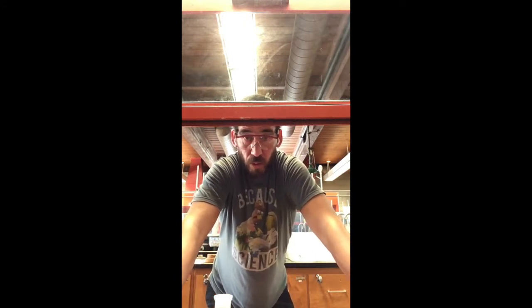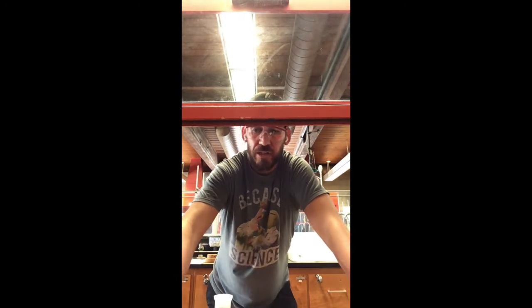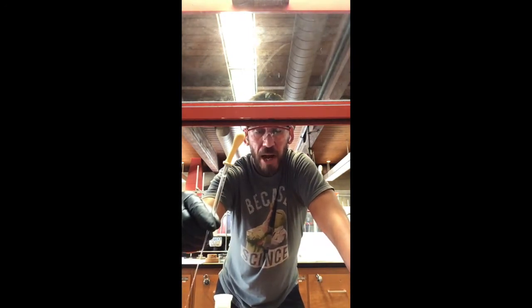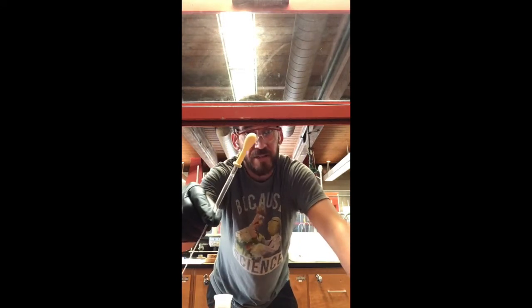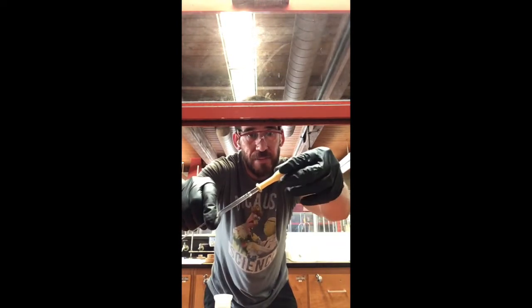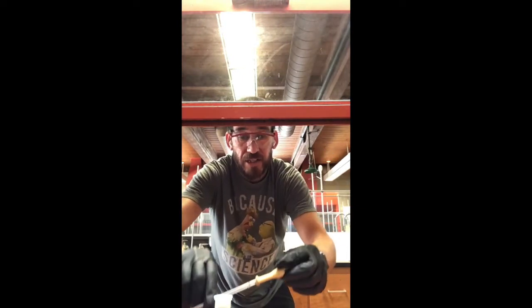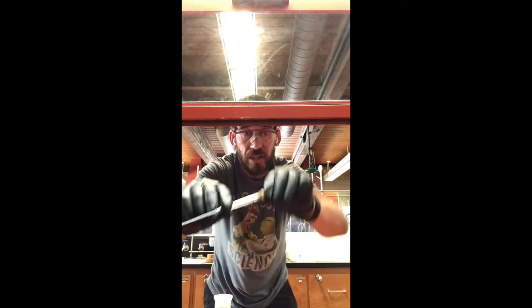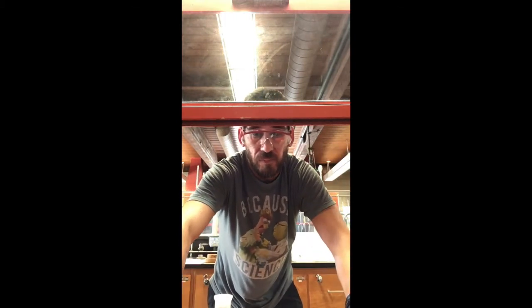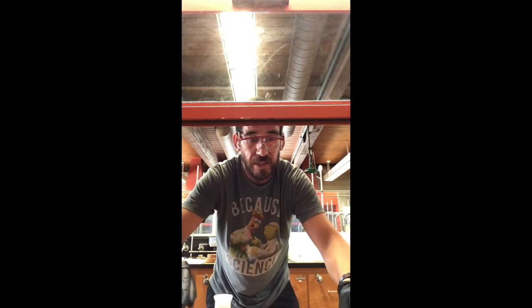Now, what we're going to do is one more extraction. But as I place this pipette down carefully, I want to remind you that you never want this pipette to be upside down. Because if it's upside down, the residual methylene chloride in here is going to climb inside of this, and it's going to ruin it. So if you don't trust yourself, just separate it, okay? And then have it sitting there.